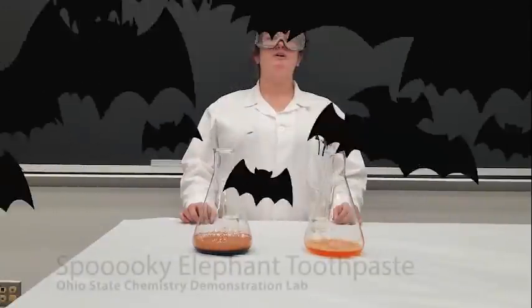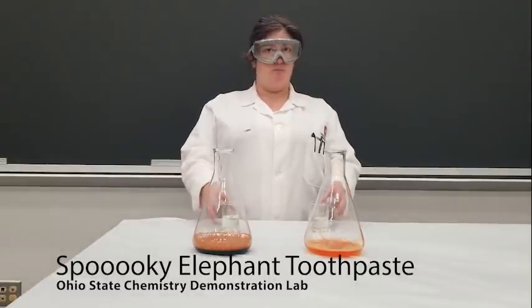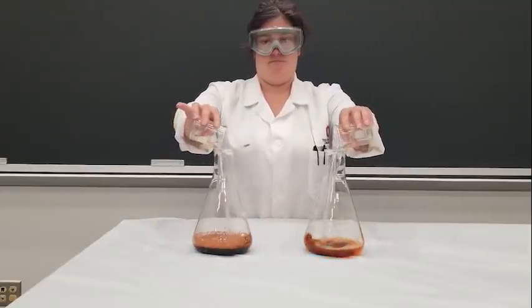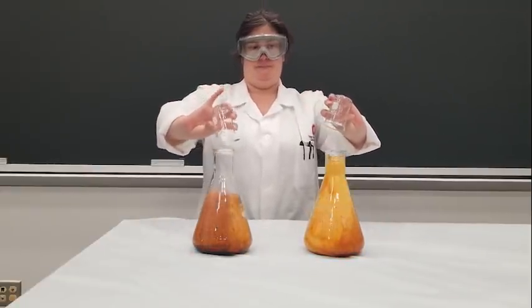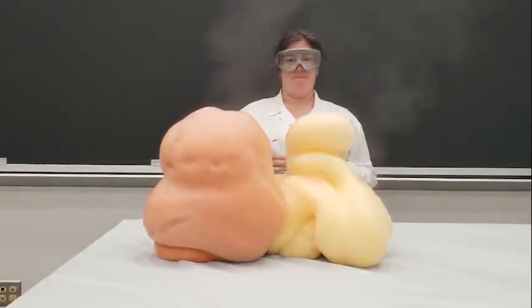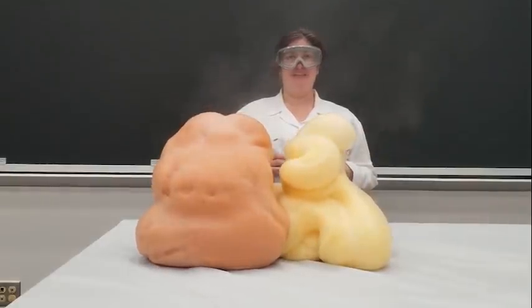You might be familiar with the elephant toothpaste demonstration, but have you ever seen spooky elephant toothpaste? I love cyan.